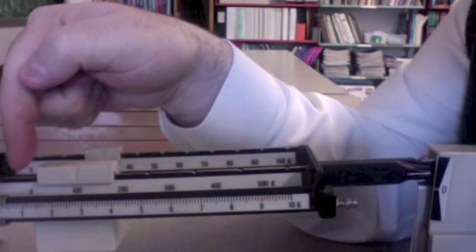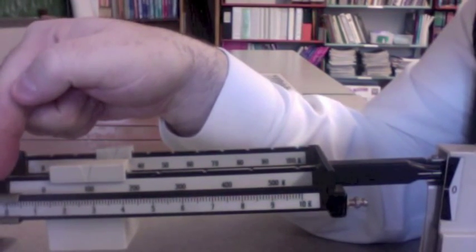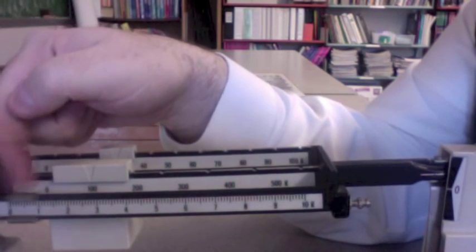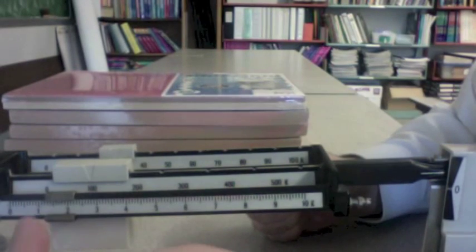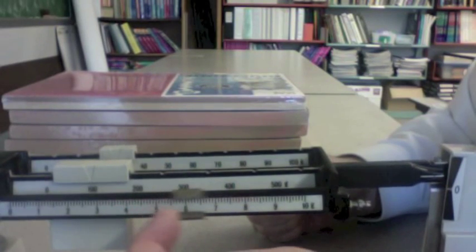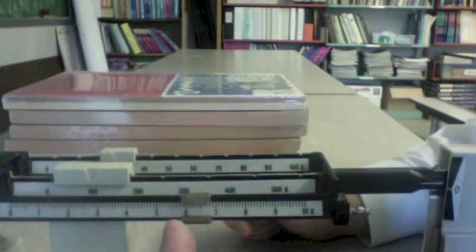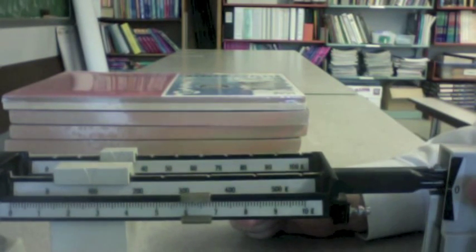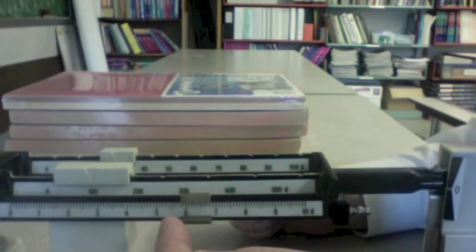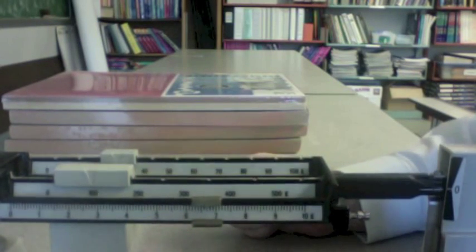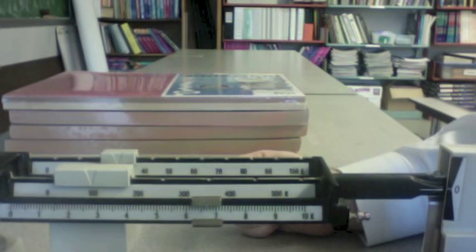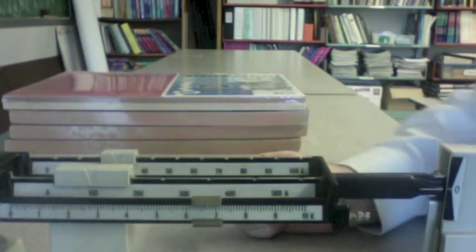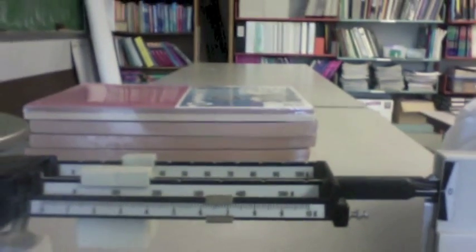And the slider in the front, well, it doesn't lock into position. It can slide pretty easily. So I'm going to take my finger, and I'm just going to slide it along as gently as I can. And I start to get some movement. And once it moves, I might want to let it move a little bit and then settle. And I notice that my line is still above the zero, so I need to go a little bit more. Let it settle. And that looks pretty close. So now my balance is balanced.